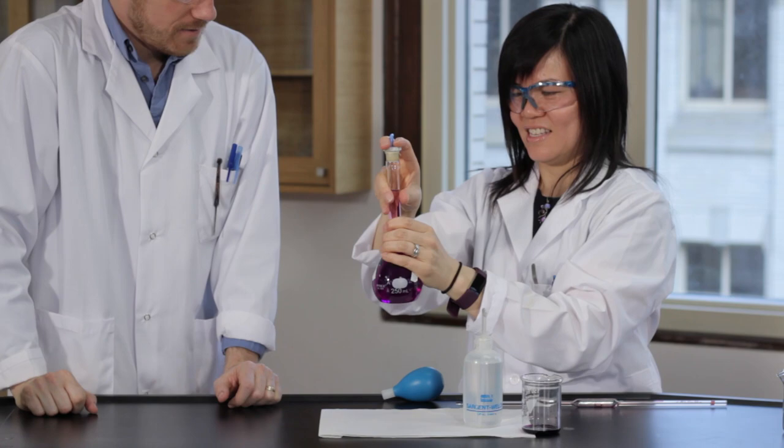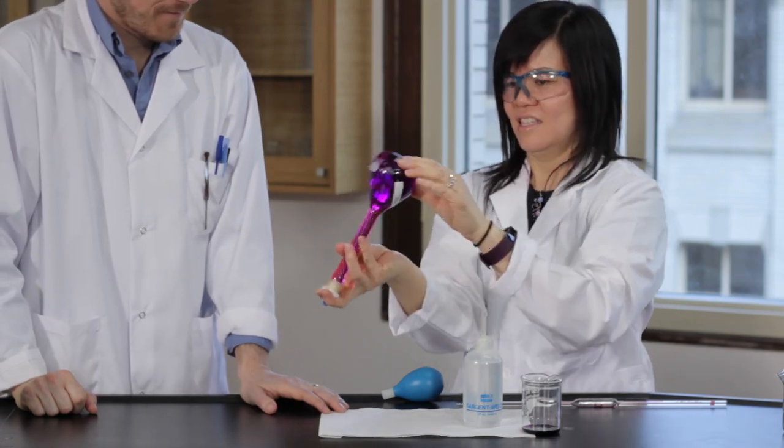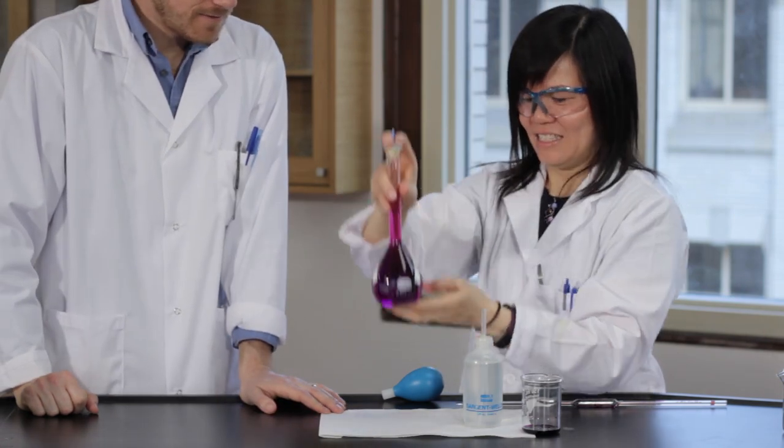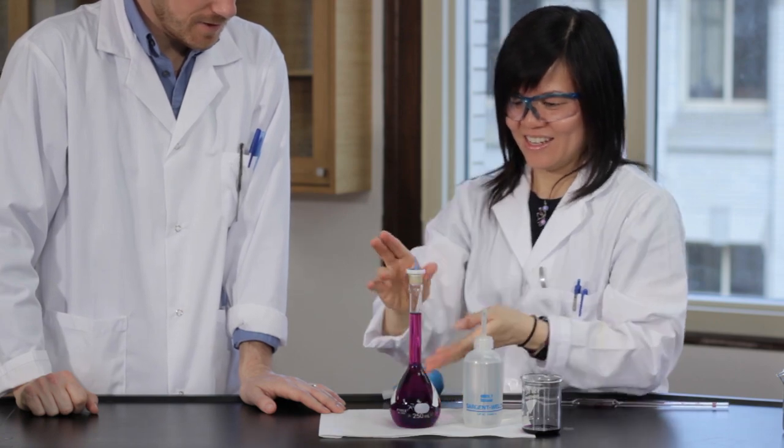Shake well to mix the solution. This solution is known as the primary standard solution. Do not discard it until the end of the experiment.